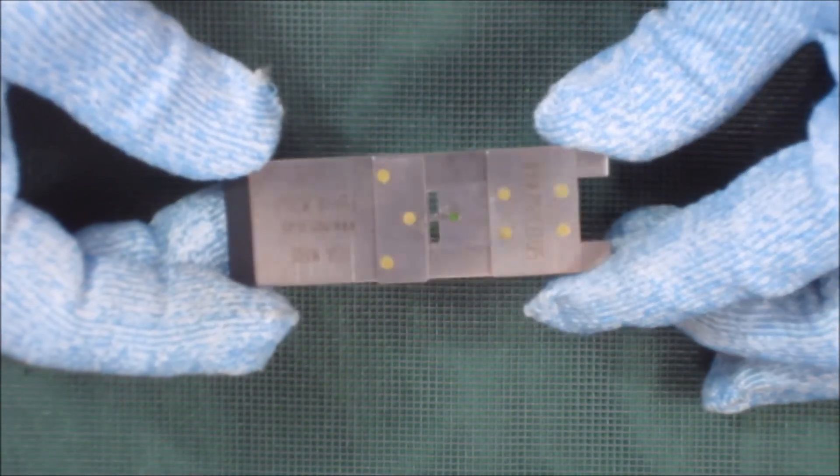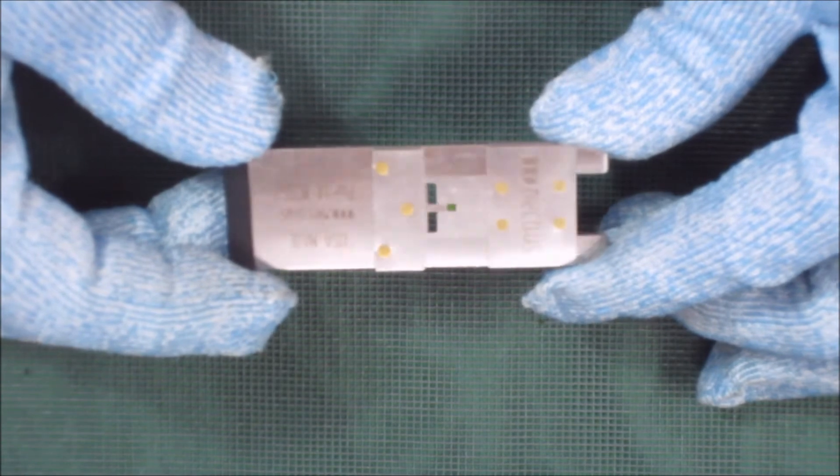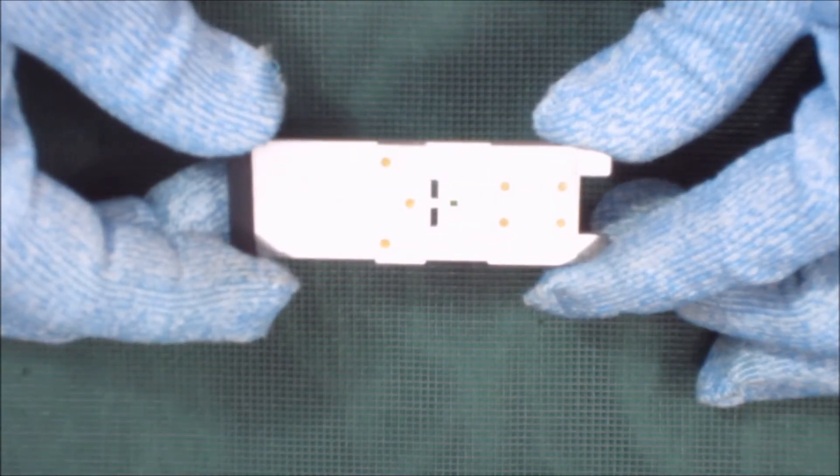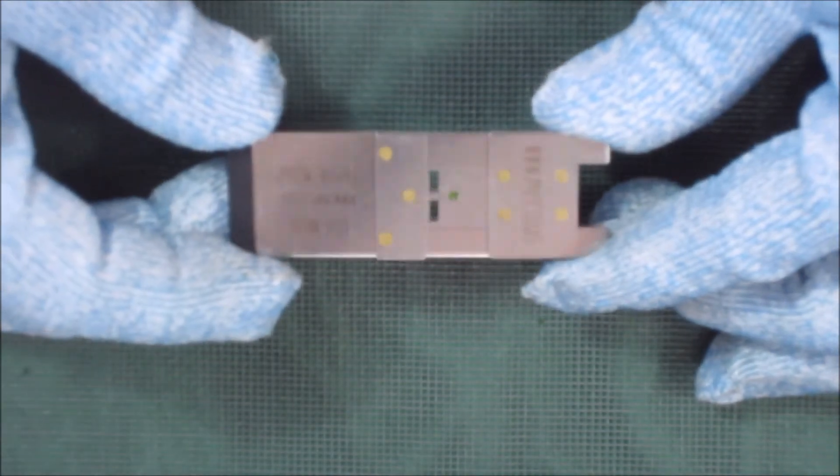Now I'm going to stop the video and I'm going to show you this sample blown up 1600 times.